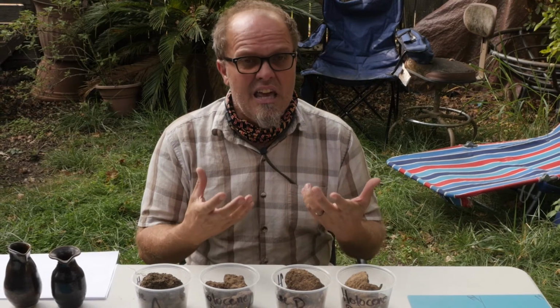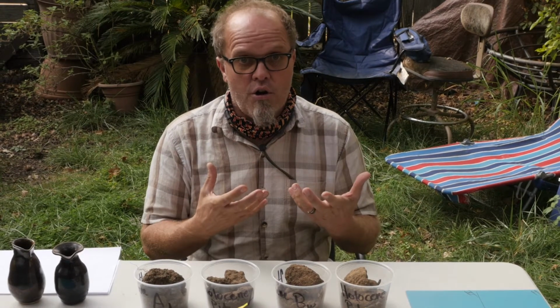We want to think about soils as this dynamic thing, but we also need to know about variables that are meaningful to help us predict properties or the effects of management on soil properties, ecosystem services, and those types of things. So one of the things that happened early on in soil science was physical fractionation, being able to take a soil and break it down into its constituent parts, especially its physical fraction of particles.